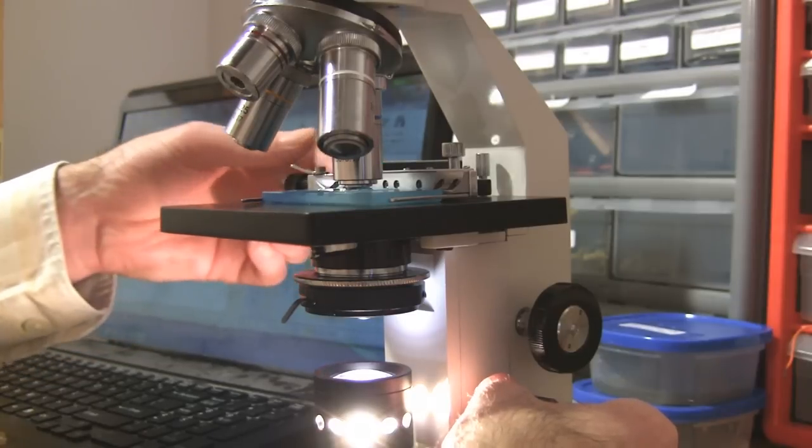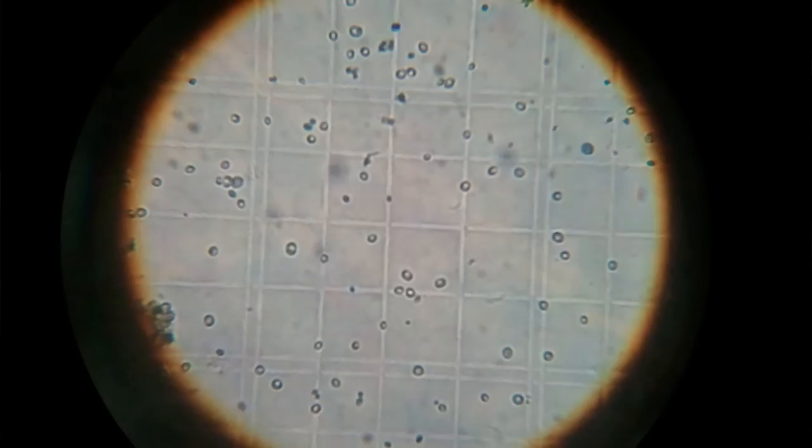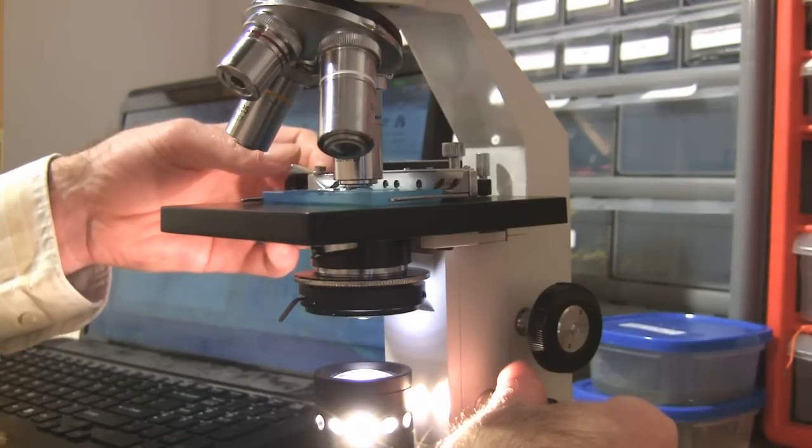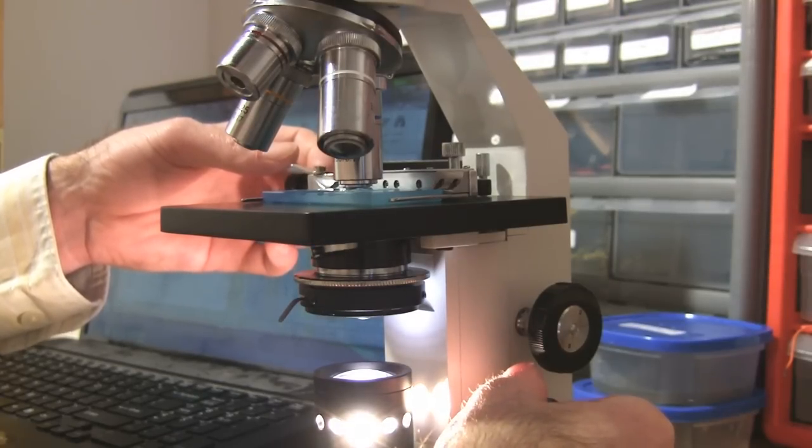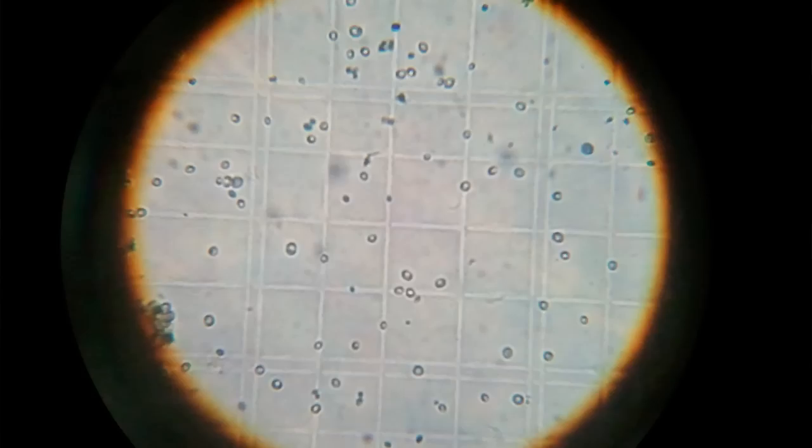And you're probably going to need to open up the diaphragm just a little bit and adjust your focus so that the blue dead cells are very clearly blue, but they aren't blurry.